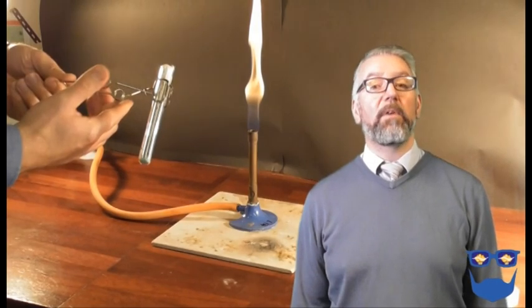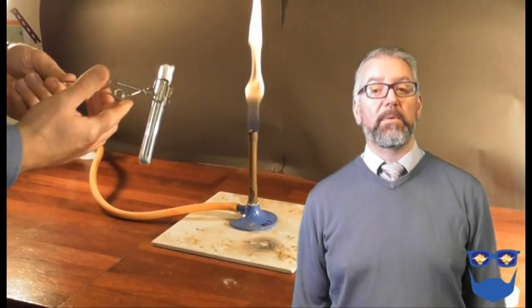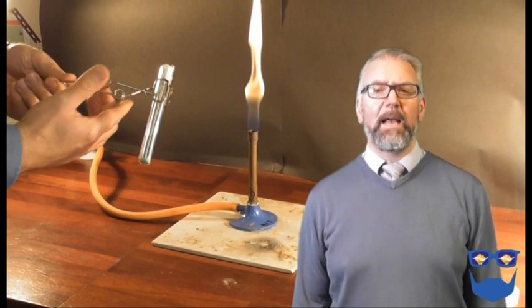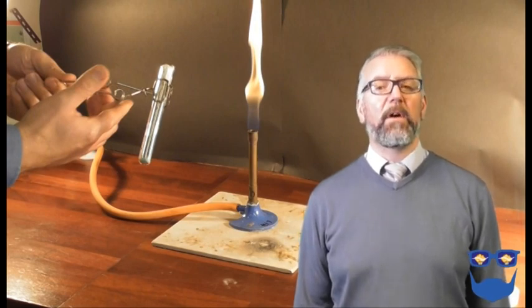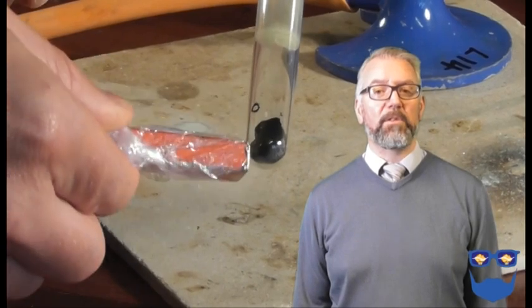I would ask the students to complete a write-up of this experiment underneath their prediction. They would draw the experiment, write down their observations and link it to their prediction, finally adding some safety information.